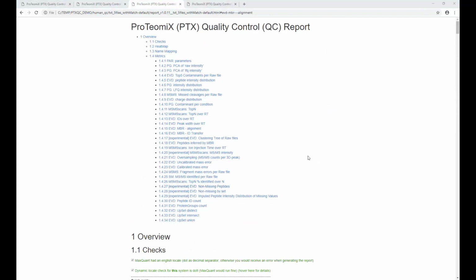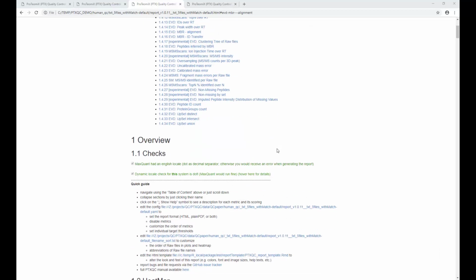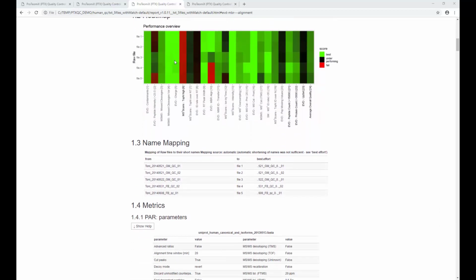Welcome back. I pulled up another report, which is from a human QC sample, which was actually also used in the publication script of PTXQC. So here, if we inspect the heat map, we can see that we used 5 raw files. Here you can see the metrics, and there's something going on here. Again, top N is not really what it should be, but that's nothing we can change after the fact. We just know we can maybe do better next time.